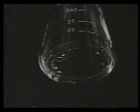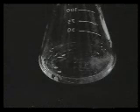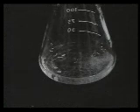It looks so easy, but what do you do if no crystals form, when the flask is on the bench, or even after longer cooling in an ice water bath? In this situation, you must induce crystallization by nucleation. Scratch the inside surface of the flask at the meniscus with a glass rod to provide small pieces of glass around which the crystals can grow. Another method is to seed the solution with a crystal of pure compound if one is available. If neither of these methods work, the solution should be concentrated further.